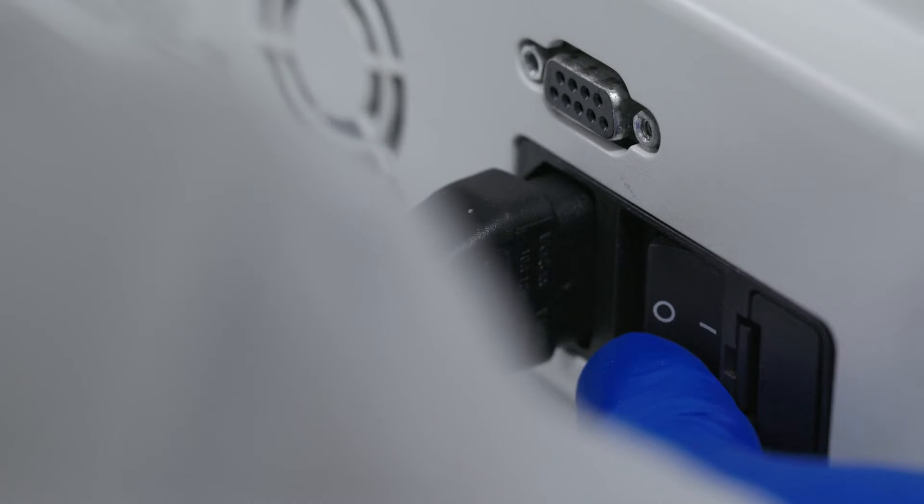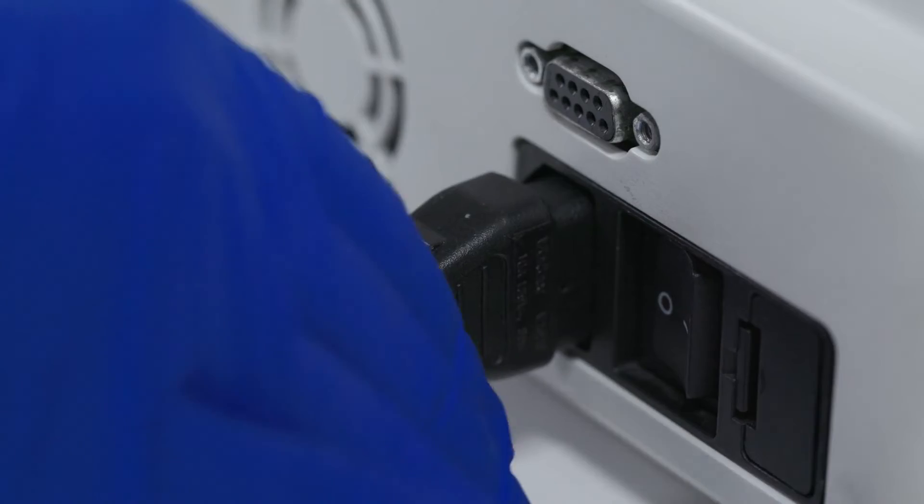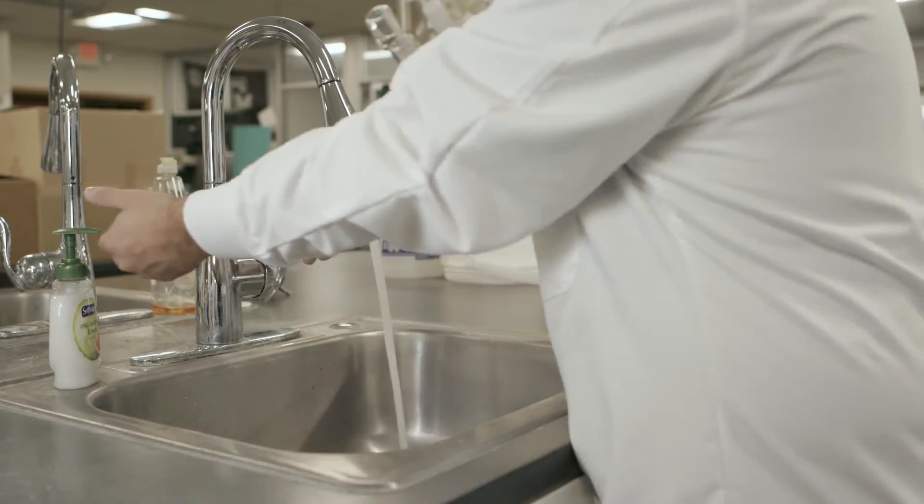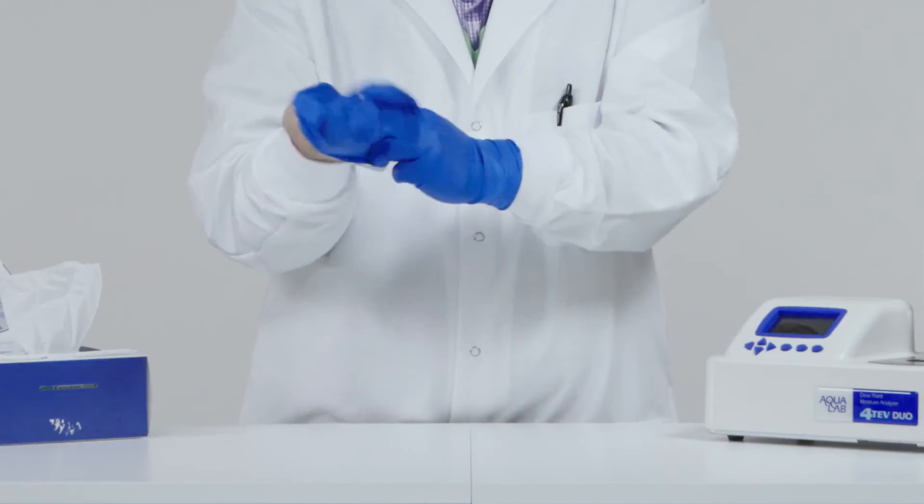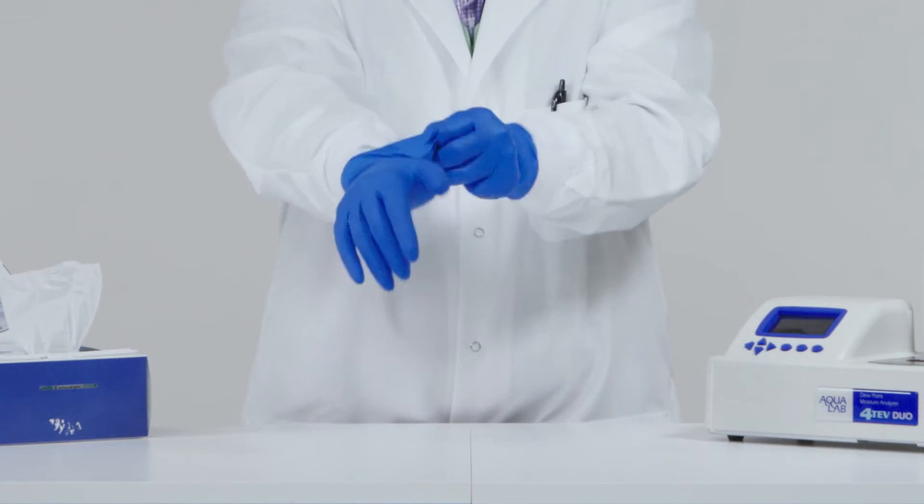To start, turn off the power to your instrument and unplug the power cord. Wash your hands thoroughly or wear lab gloves so dirt and natural oils on your hands don't contaminate the cleaning materials or the sensors.